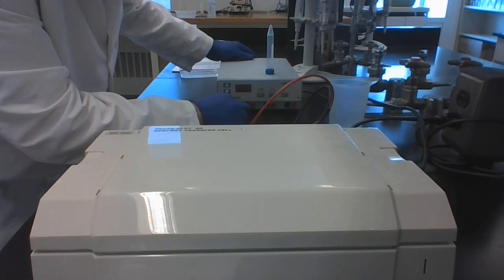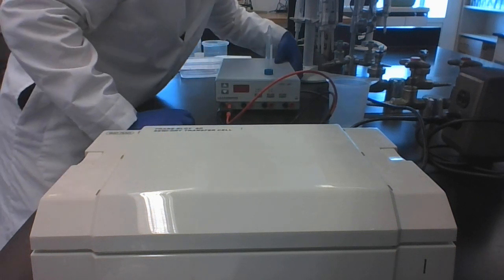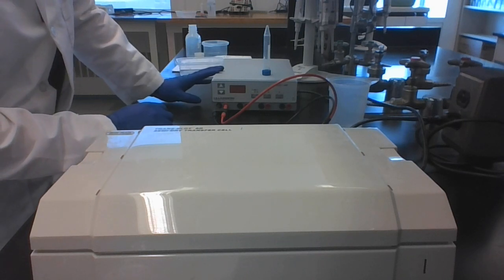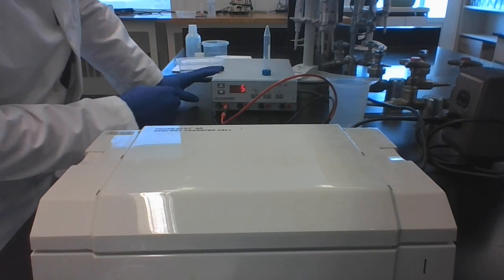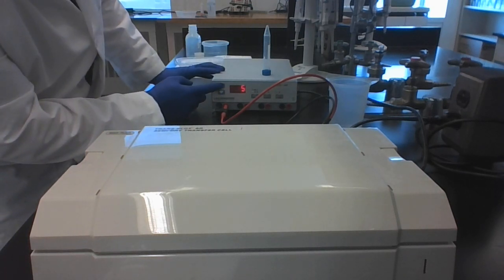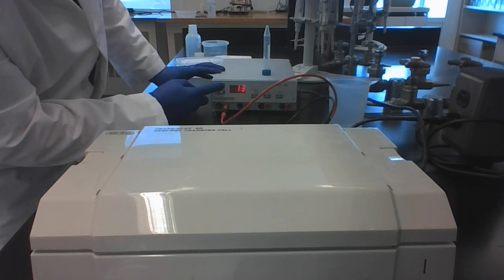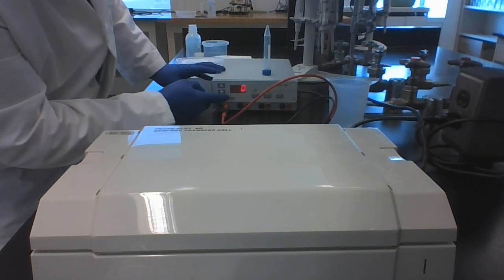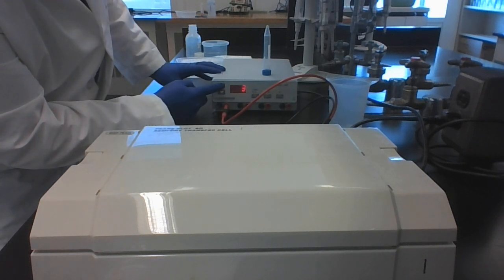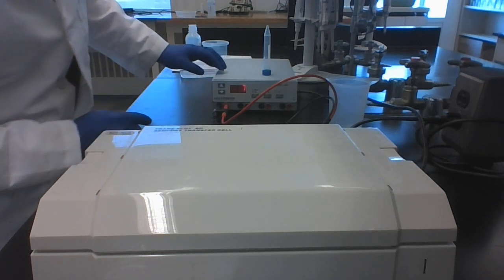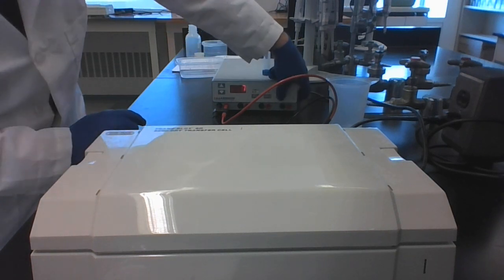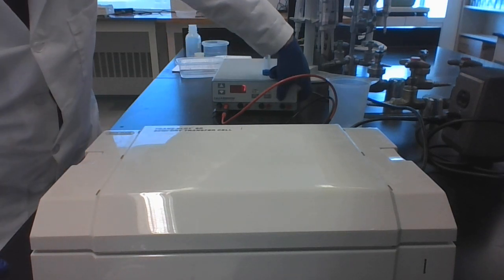And then we plug this in, turn on our power supply. We set the voltage to 20. We can then set the time to seven minutes because it takes seven minutes to do this. And then we hit start. I'll pause the video and we'll come back when this is done.